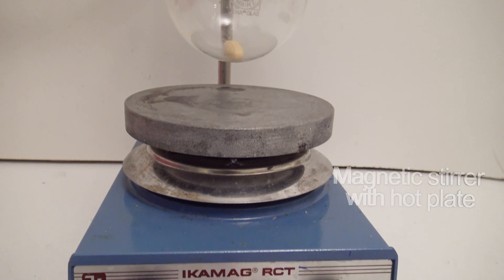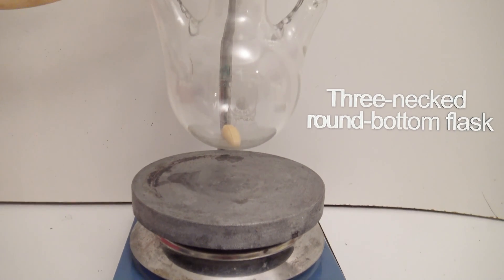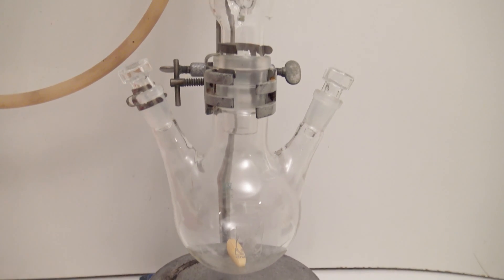In the beginning the apparatus was made of a hot plate, a three-necked round bottom flask with a stirring bar, and a Dimroth condenser.